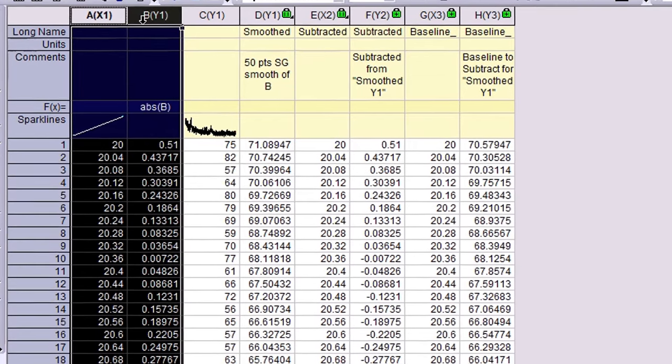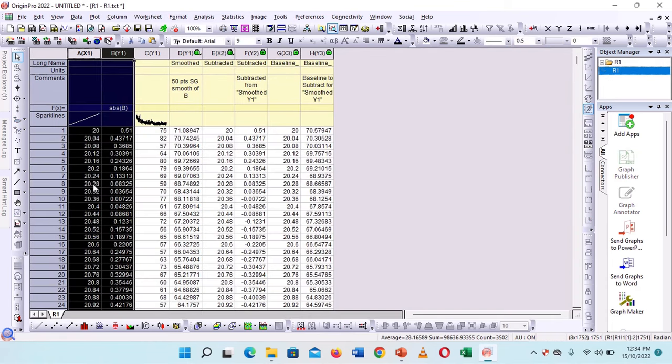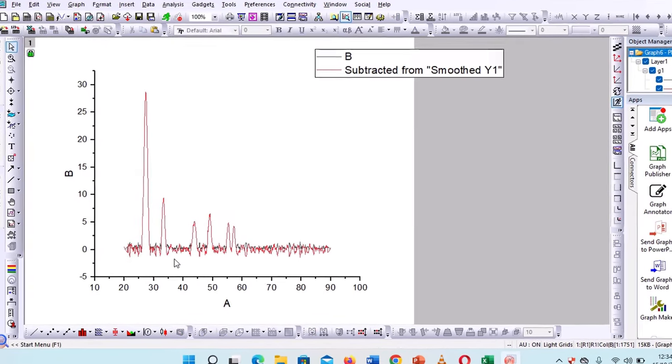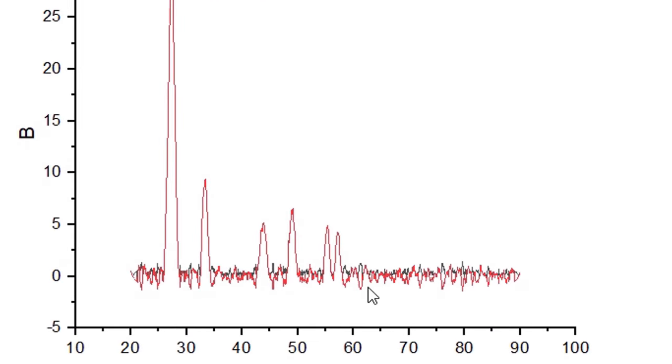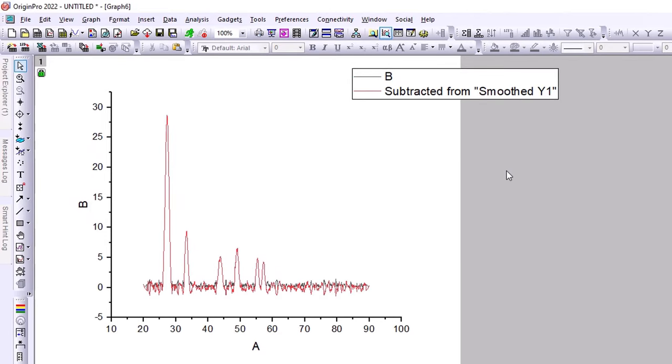Now the graph will show you the baseline is correct and the values are not negative. If I show the comparison, these values are positive, these values are negative. In this graph, the graph shows the negative values. We will smooth the data and correct the baseline. This is the XRD data. In this pattern, UV, FTIR or other techniques can smooth the data. Let's click update.